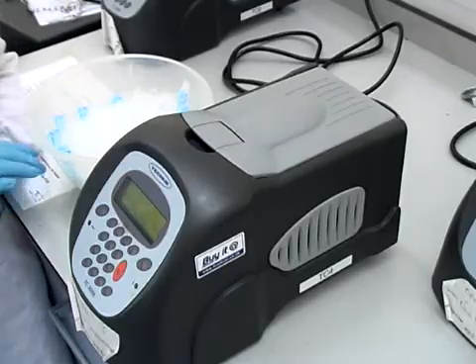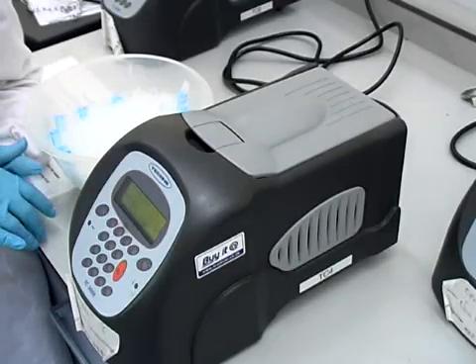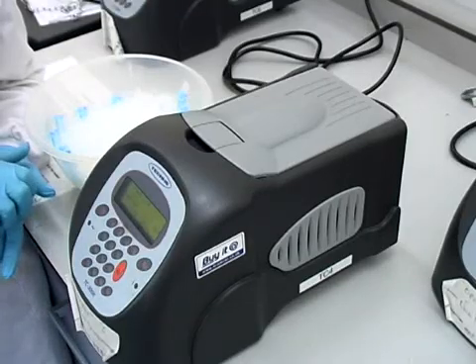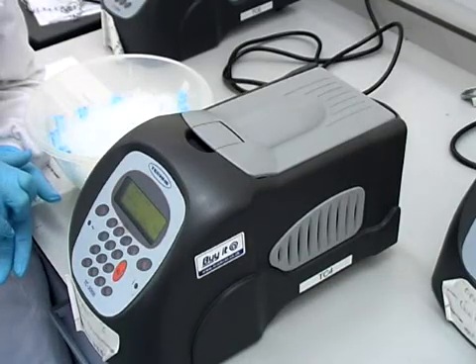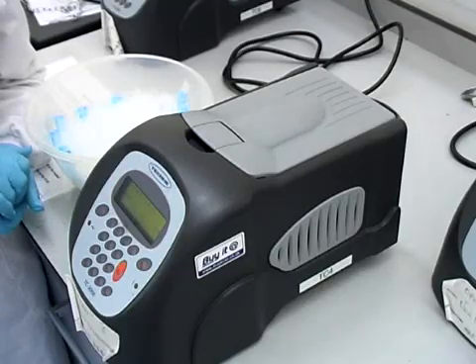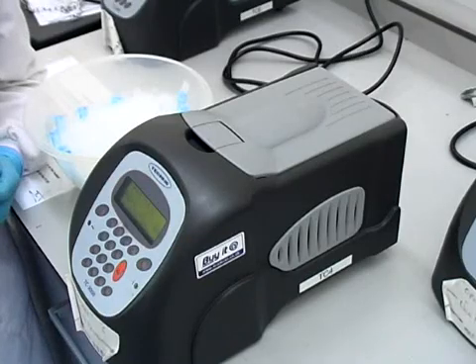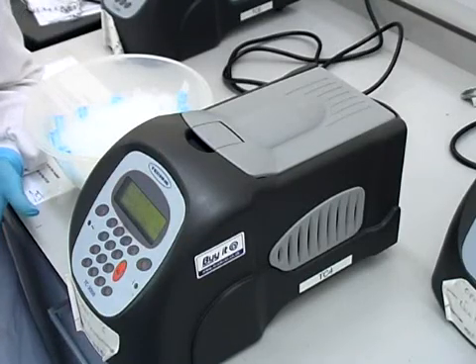The initial temperature is 95 degrees for five minutes and this allows for complete denaturation of the DNA. And then the double-stranded DNA separates and the primer attaches once it's cooled to 45 to 60 degrees. This is where the annealing of the primer and the single-stranded DNA occurs.